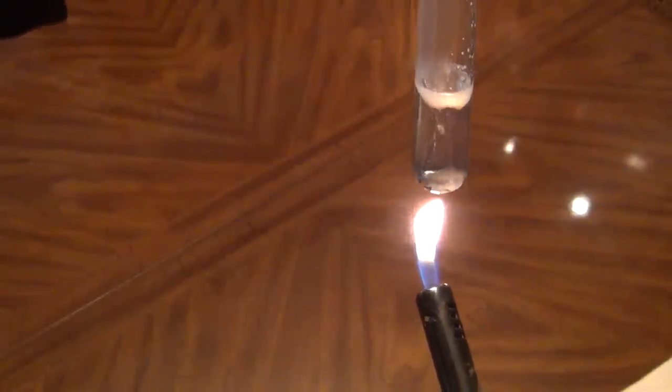All right, that's ready to go. Now just pour it into your desired amount of water and you're ready to use it.